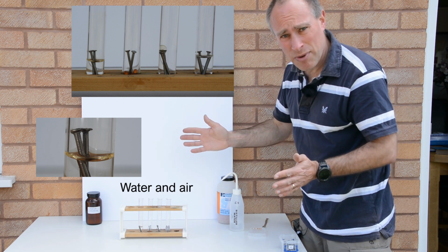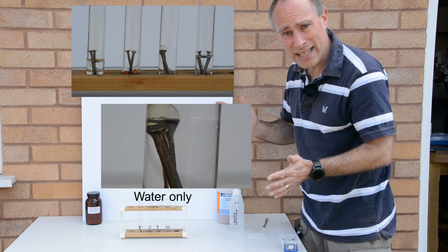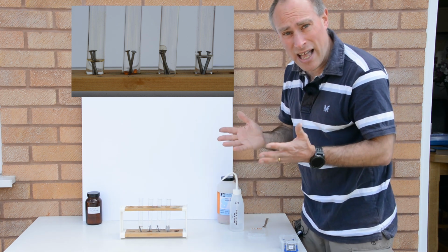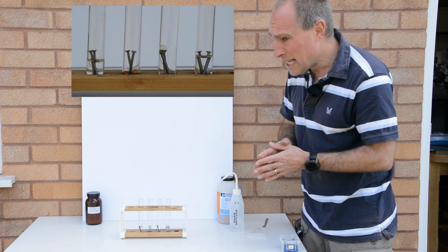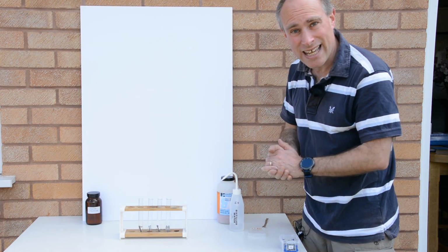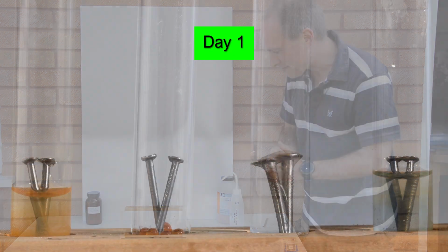So we're going to run this experiment for a couple of weeks, and I'll take images of the test tubes every day over that period of time, and we'll see what results we get.